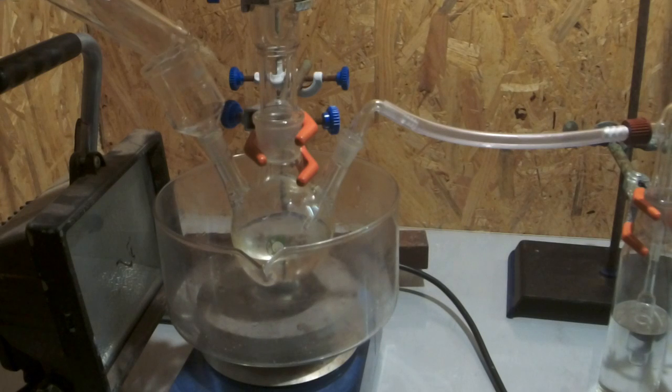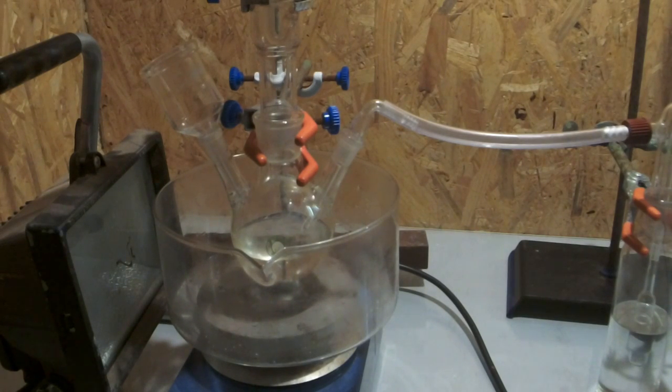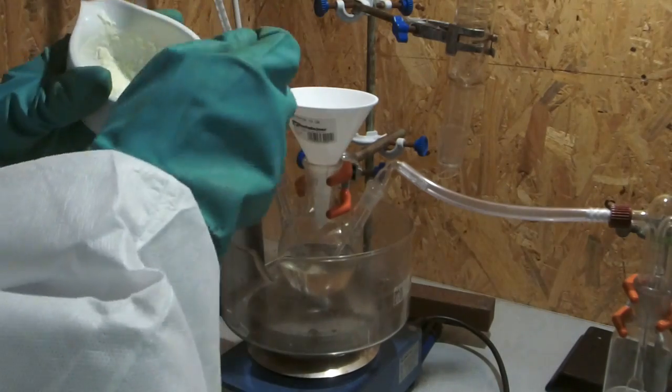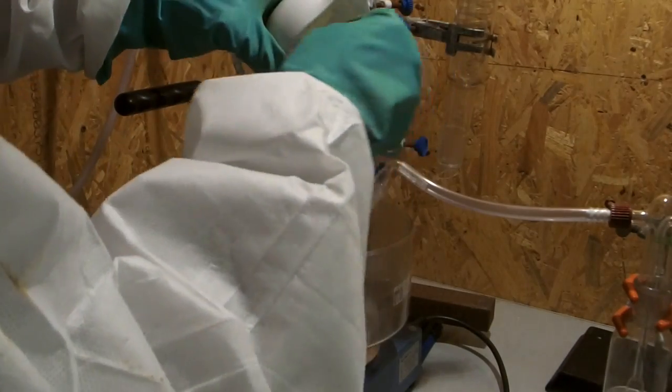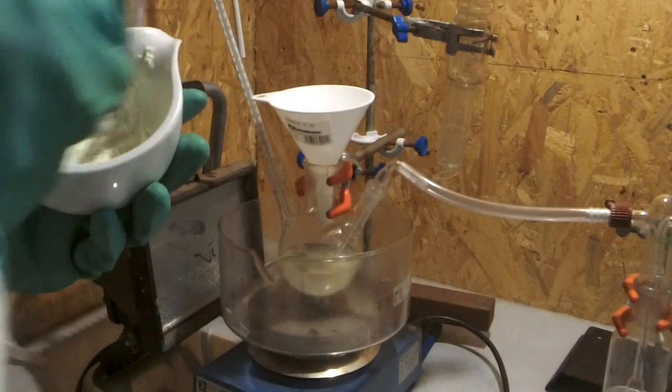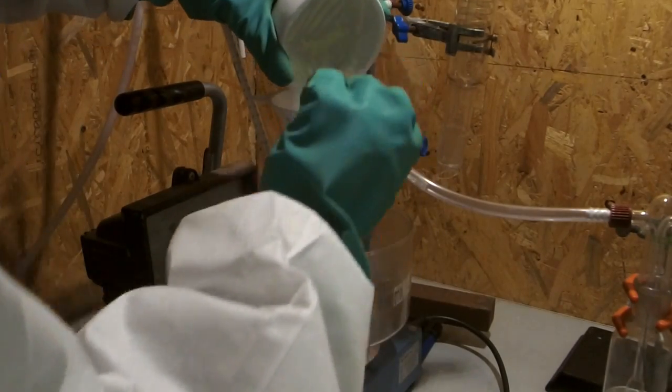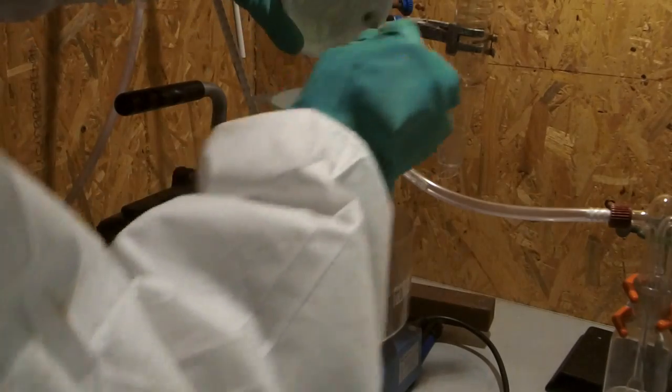I also used a water bath to get a temperature of around 95 to 96 degrees, which further speeded the process up. It's very important that you use dry chlorine gas. I dried my chlorine gas over sulfuric acid in a wash bottle.